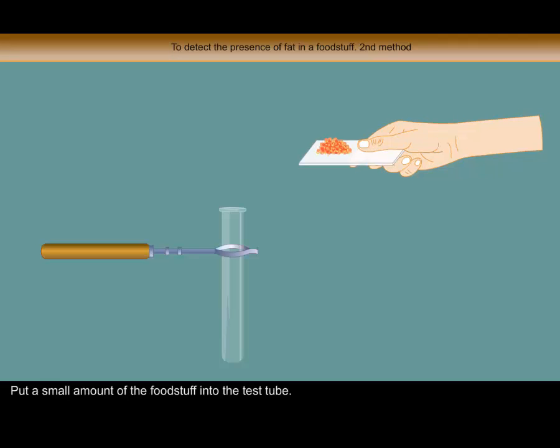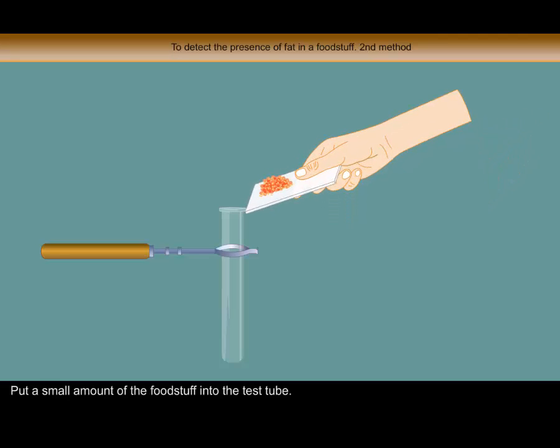Procedure: Put a small amount of the foodstuff into the test tube.